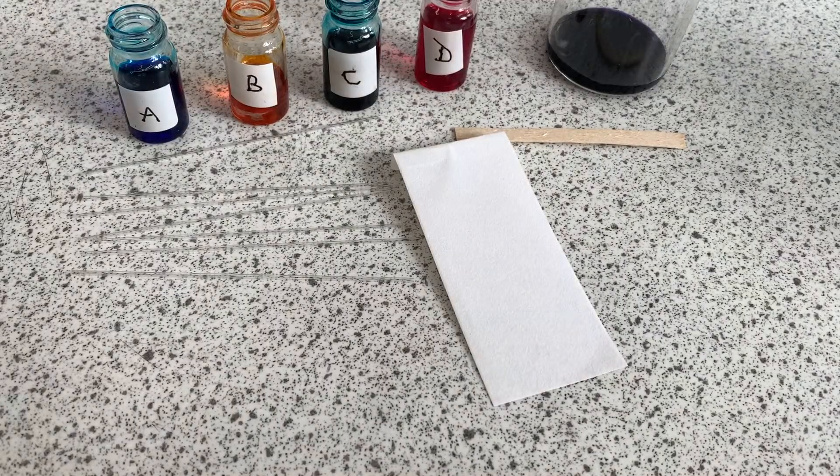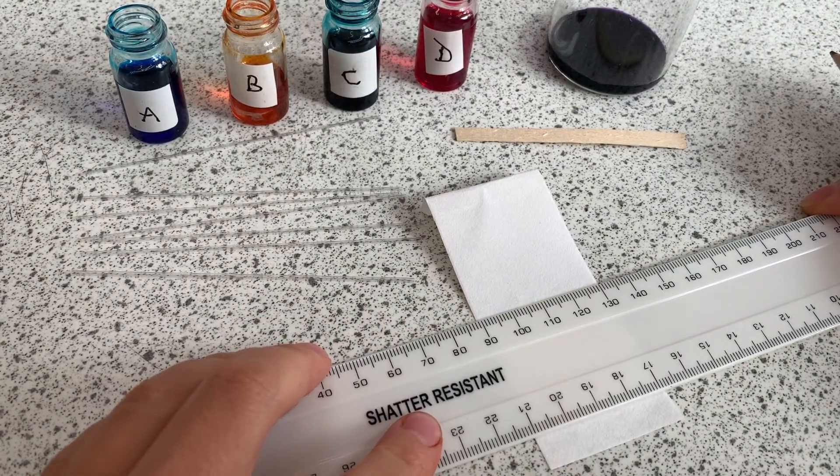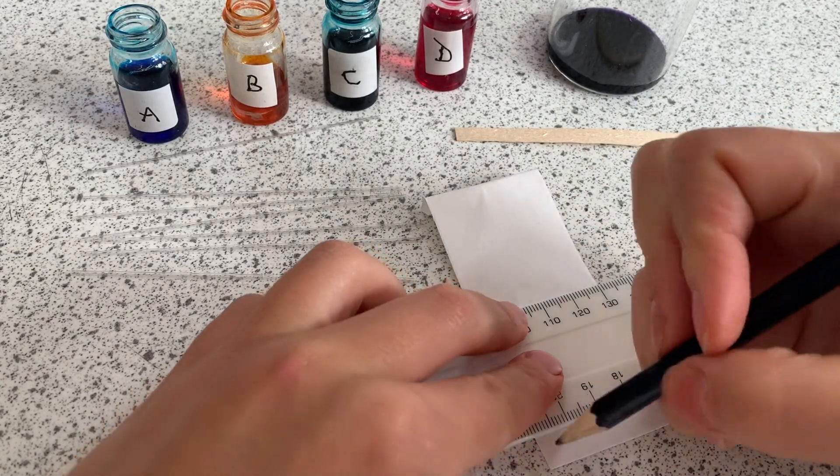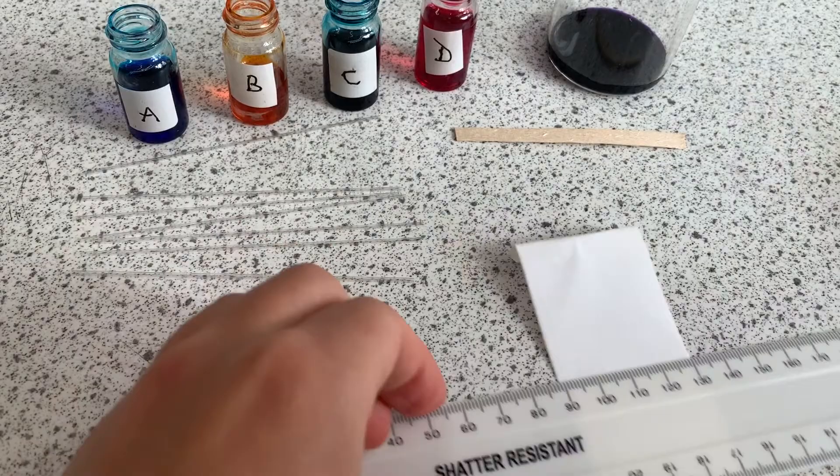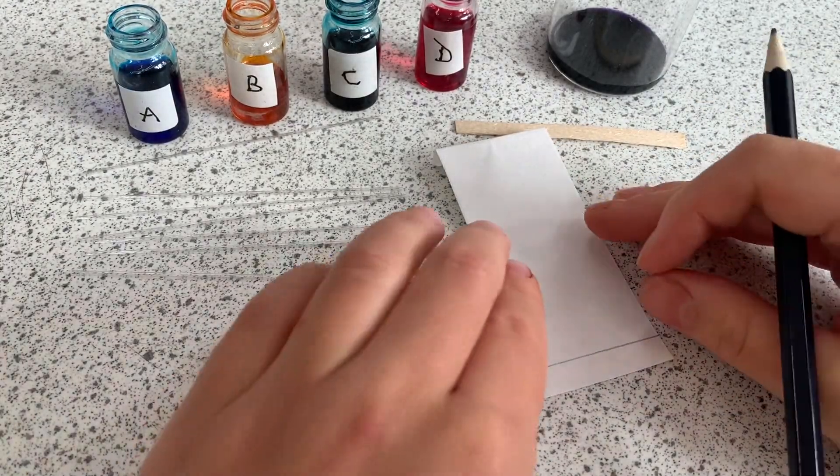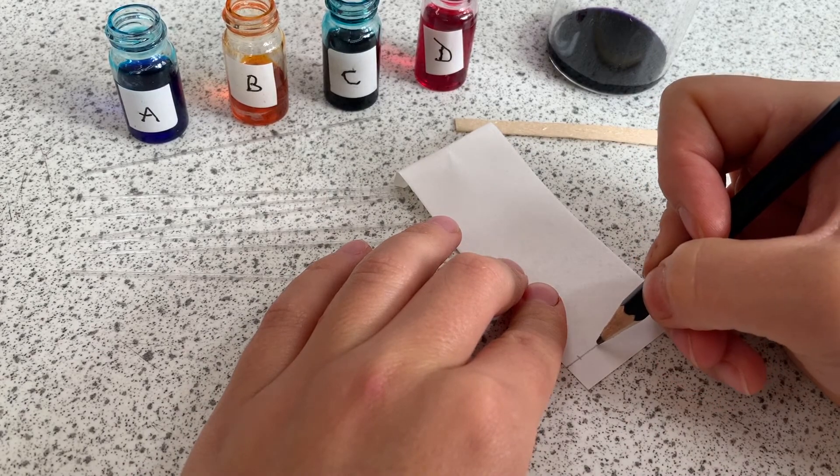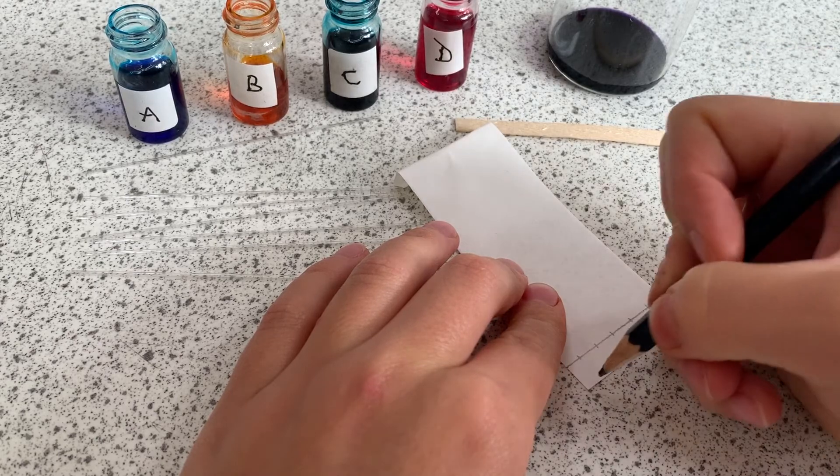Here is how you prepare your chromatography paper. First of all you need a starting line parallel to the bottom of the paper on which you're going to put dots for all your known compounds and your unknown mixture. Make sure you do this in pencil as pen would smudge and travel with the solvent. Then label where you're going to put each substance along the line.